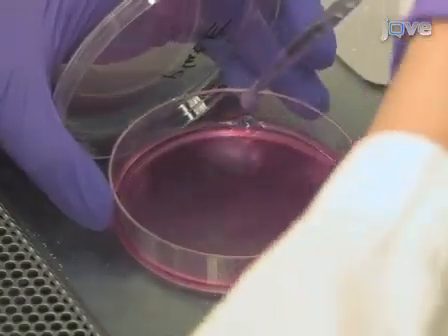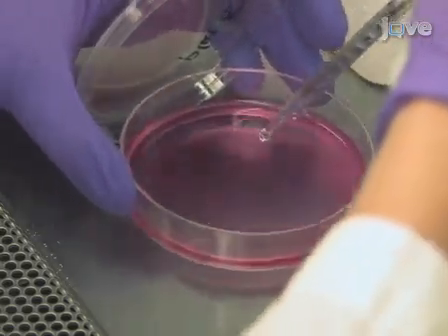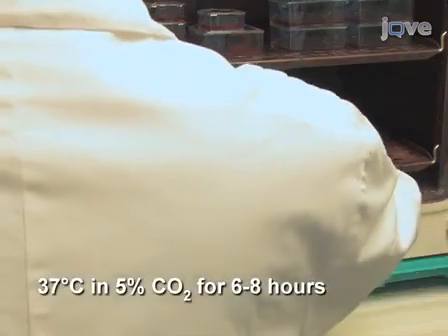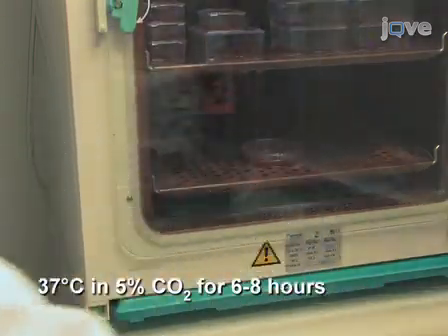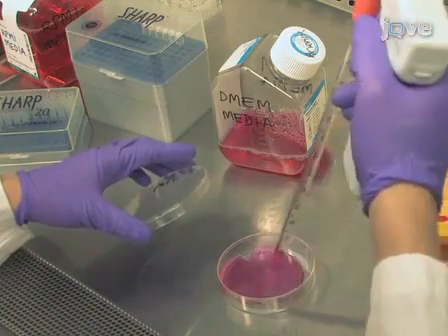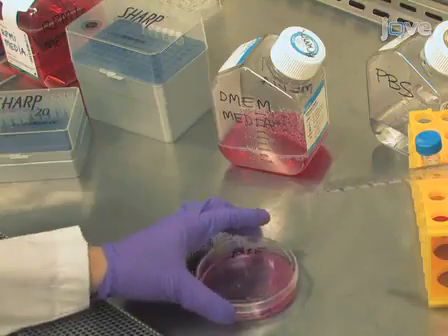Slowly drip the mixture into the platinum E cells. Gently rock the plate back and forth to distribute the transfection mixture evenly. Then incubate cells at 37 degrees Celsius and 5% carbon dioxide in a cell incubator. After 6 to 8 hours, replace medium with 10 milliliters of fresh DMEM medium for viral production.